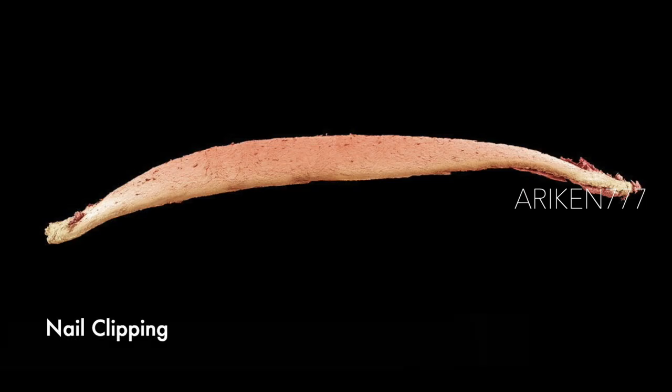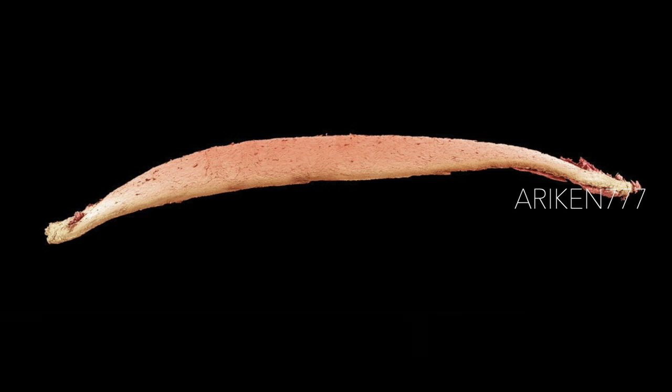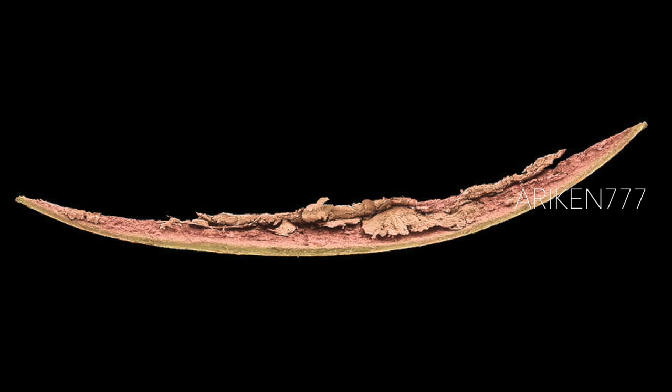Nail clippings. Fingernails and toenails are made of a tough protective protein called alpha-keratin, which is a polymer.